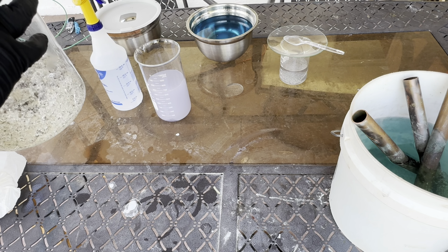I've been waiting a while to process the silver that I've had, along with the stuff that Chef V sent me. We've run a bunch of silver that I had from last year, plus a bunch that Chef V sent me, and we're finally back up to where I almost don't have very much material left. This third batch that I'm about to run is just the tail end of what I've got from gold refining and stuff left over from last year.